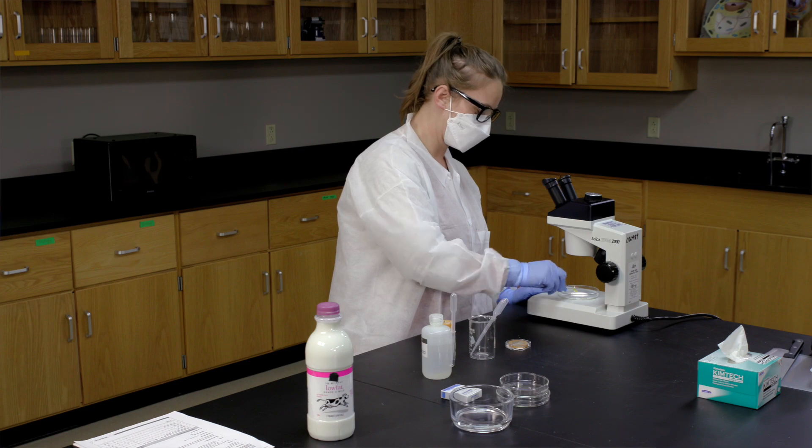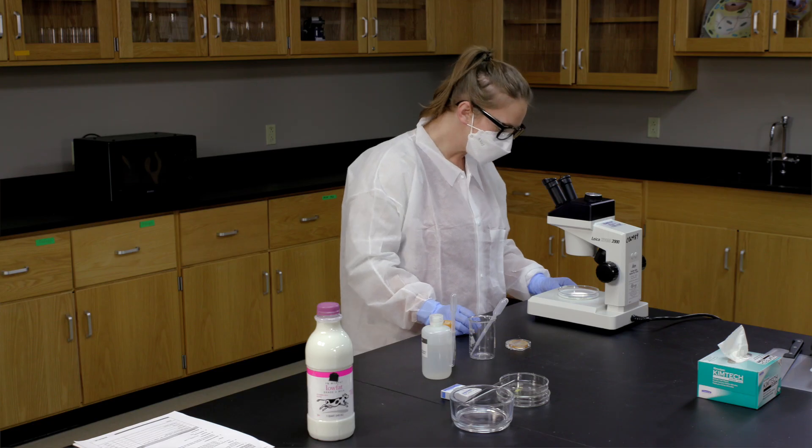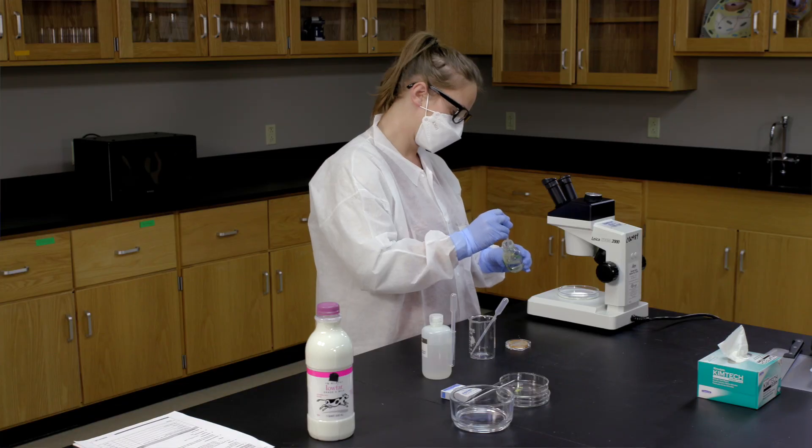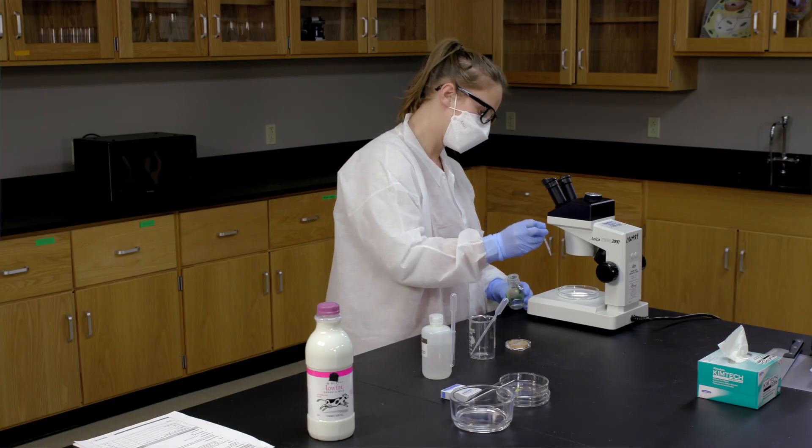We'll use the light from this microscope to help us observe. The milk looks smooth and white. Well, like milk. But what will happen to the milk protein if we lower the pH?